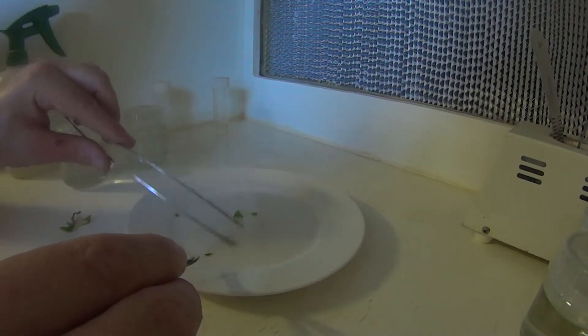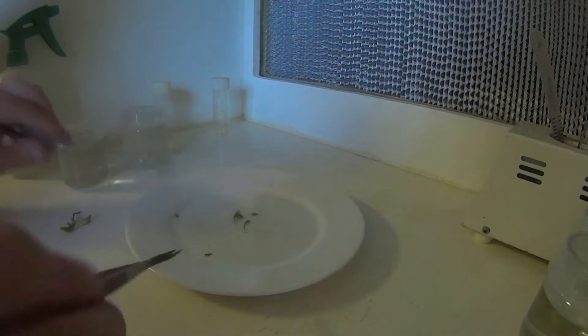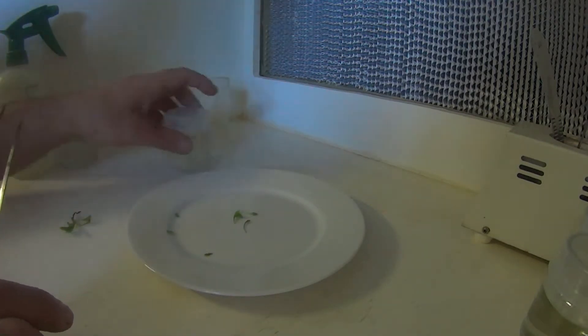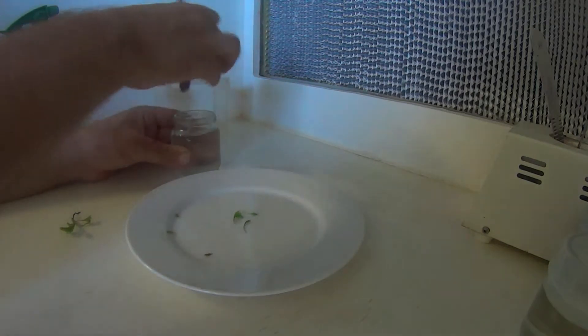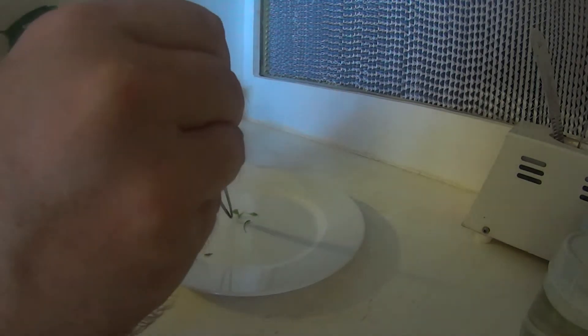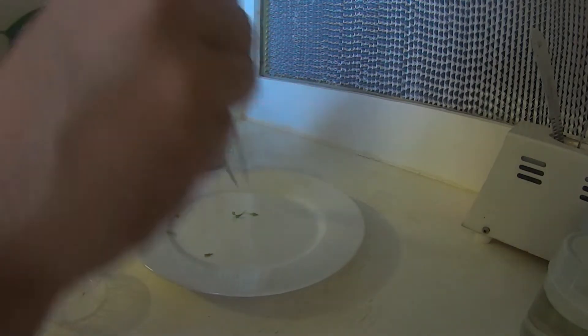So I'll just snip the traps off. All right, there we go. A few little bits for us to start with. And once again, what we do is soak them in bleach now. Venus Flytraps can be a little bit sensitive to bleach. So we'll probably only give them about five or six minutes in there.